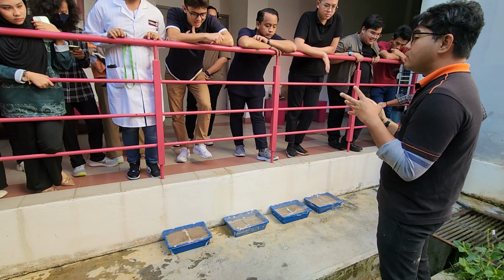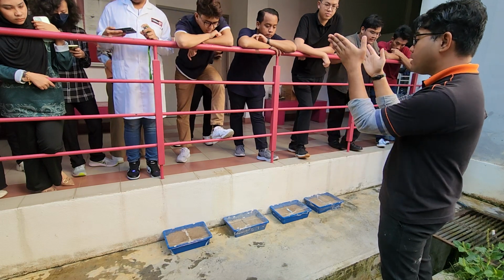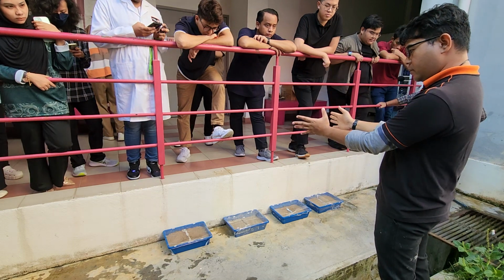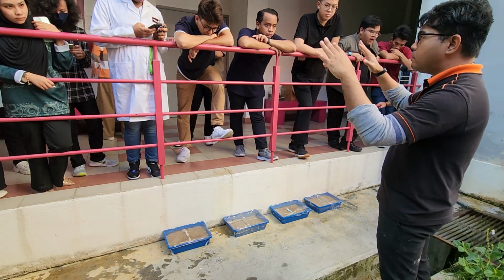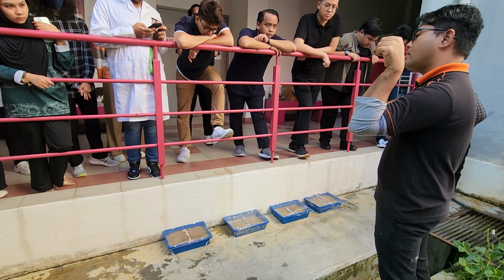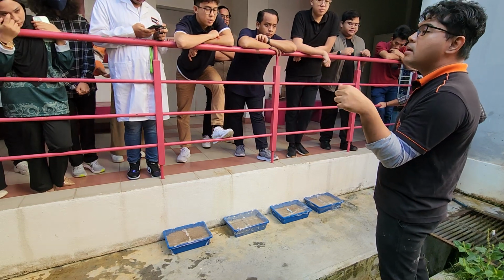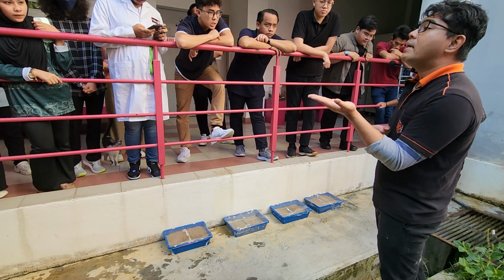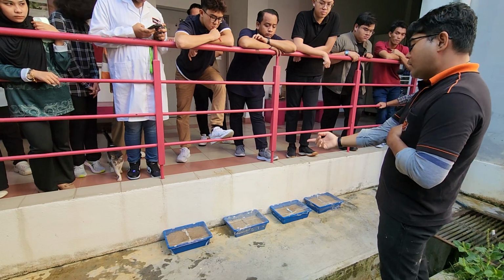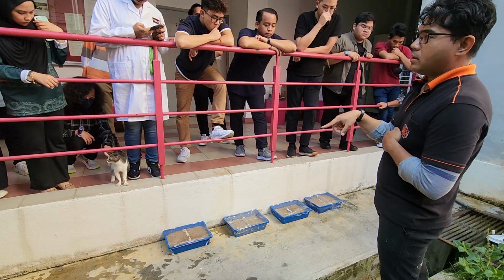So relative humidity is the amount of moisture being held at the current temperature, at the current sea level elevation for that space. Meaning that if the space is able to hold maybe 100 liters of water, and the equipment measures only 80 liters of water present, it shows your relative humidity is only 80%, 20% to go. Okay, so we increase the humidity up to 100% here to facilitate germination.